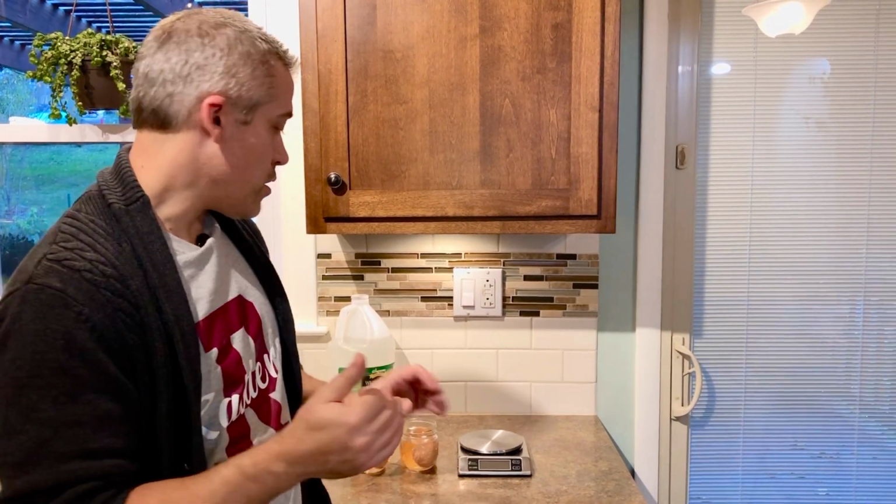and we're going to leave that overnight. Now, usually I would give that about 24 hours because we would have class one day at a certain time. We'd let it sit for a day and then come back to it 24 hours later. So sometime tomorrow, I'm going to come back and start this up again, and I'll show you what our result will be. Stay tuned.